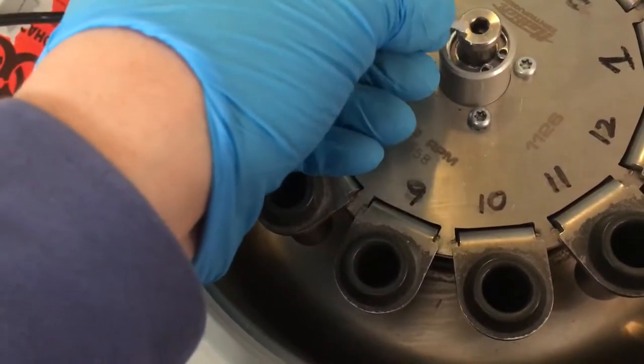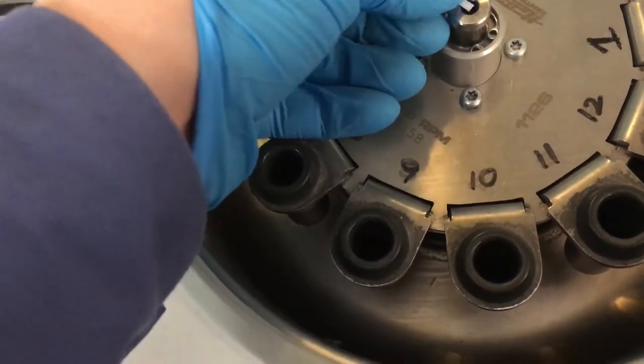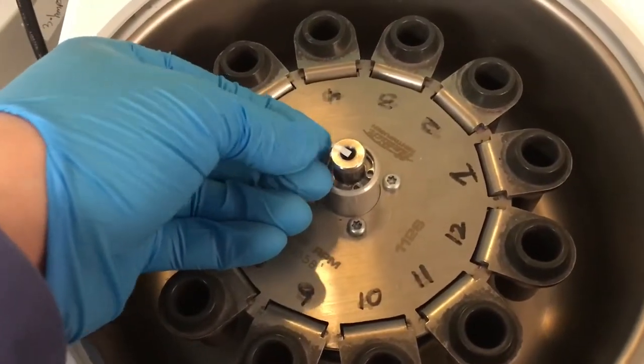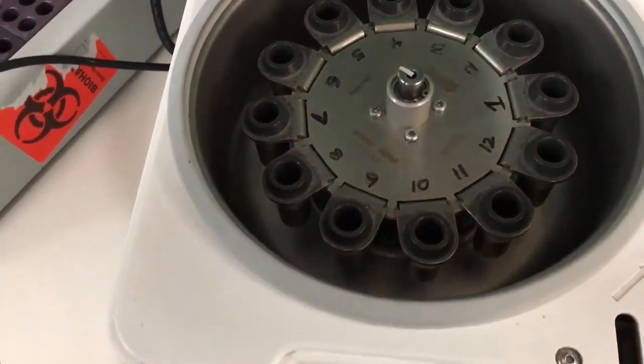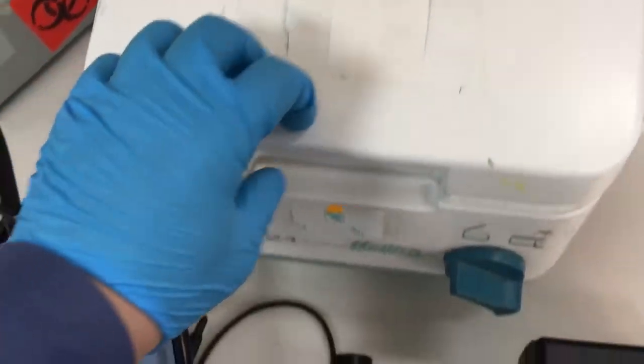Let's measure speed. Okay, let's put it here. Close the lid.